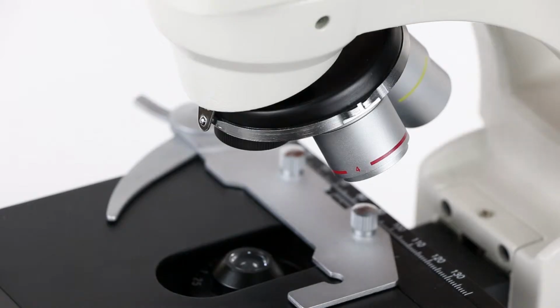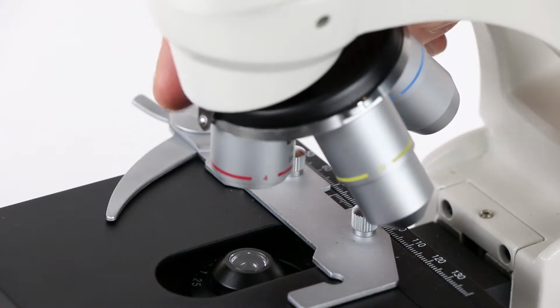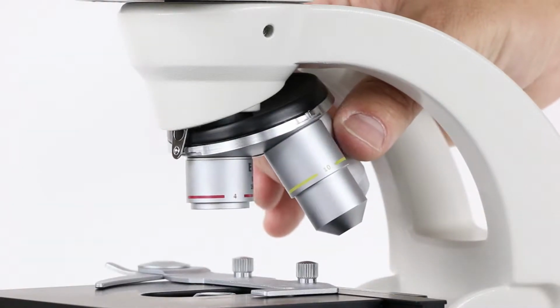First of all, I want to point out some of the lenses that we find on the microscope. On the eyepiece, we have the ocular lens that has a magnification of 10x. Then above the stage, we have this revolving turret that's called the revolving nose piece. As you turn this, you can select different lenses. These lenses are known as objective lenses.